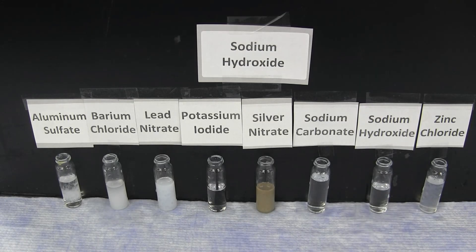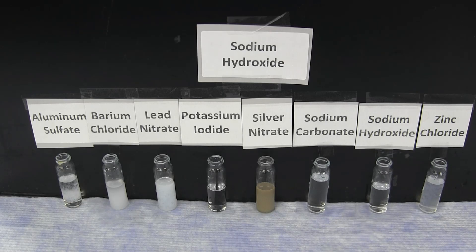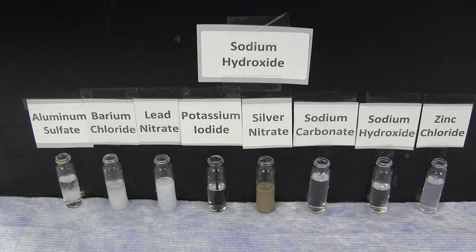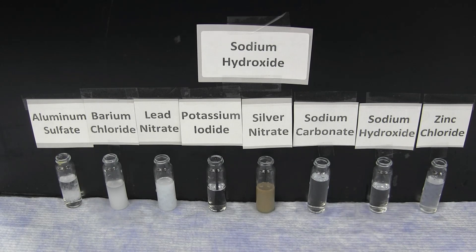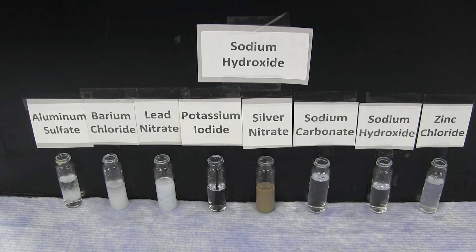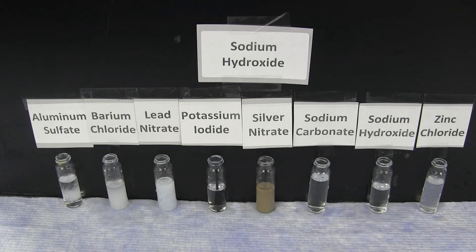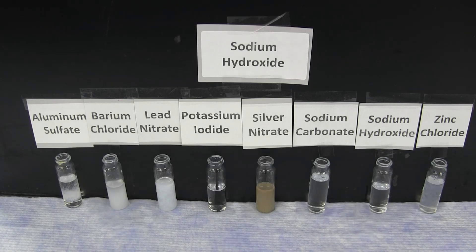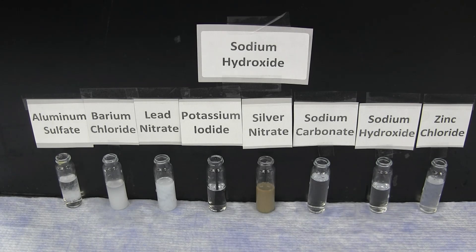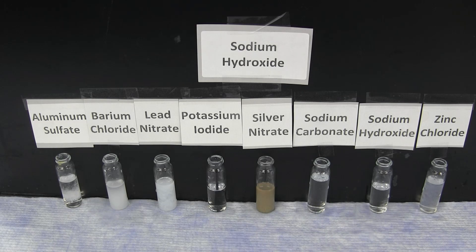The sodium hydroxide forms a white precipitate with aluminum sulfate, barium chloride, lead nitrate, and zinc chloride, as well as a brown precipitate with silver nitrate. There is no reaction with potassium iodide, sodium carbonate, or sodium hydroxide.